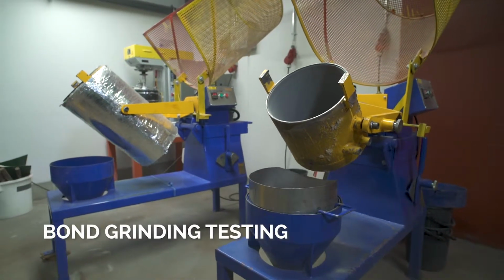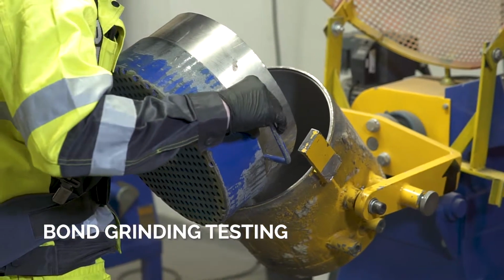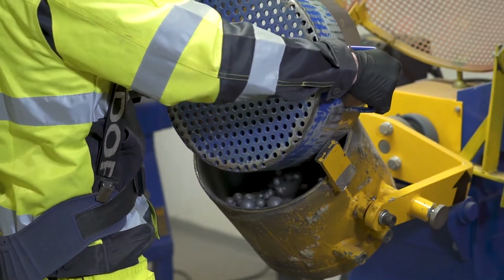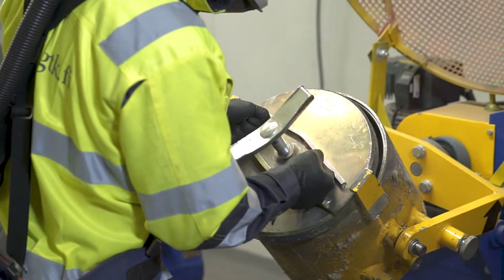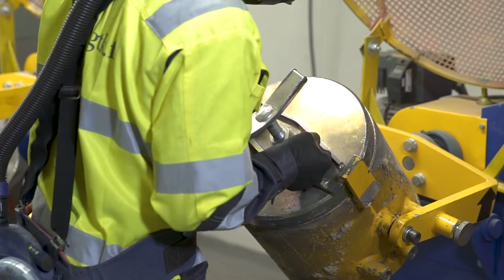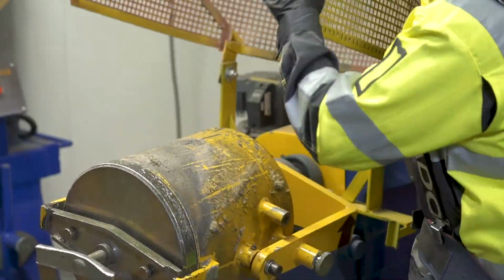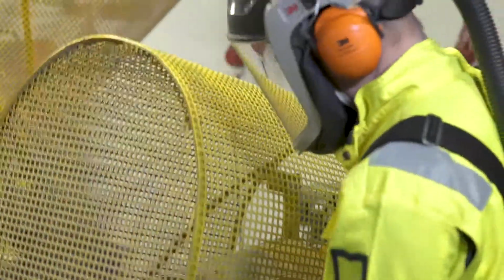The standard Bond ball mill grindability test is a locked cycle dry grinding and screening process. The aim is to achieve a 250% circulating load compared to the cut screen undersize.